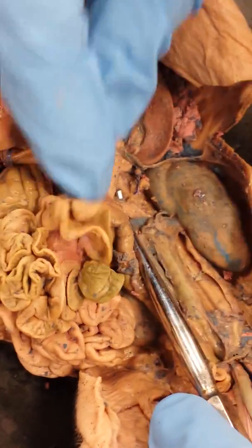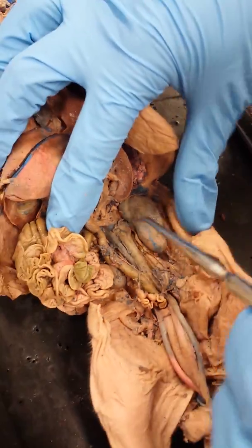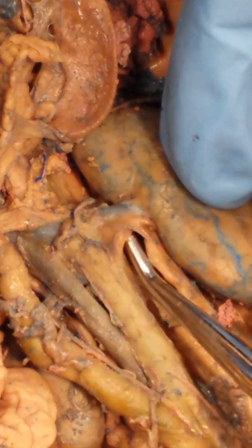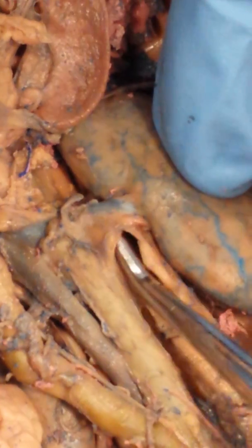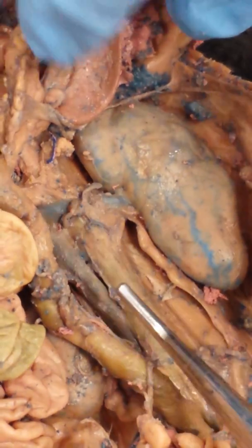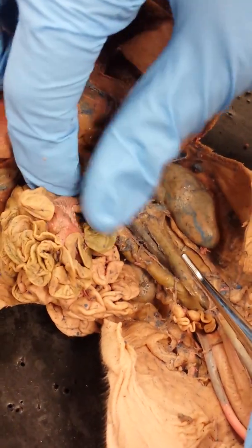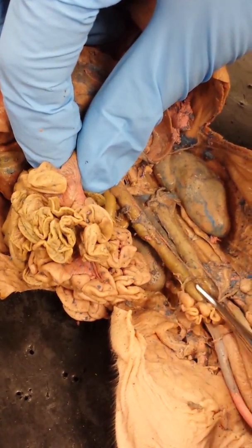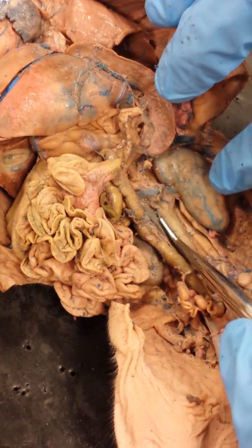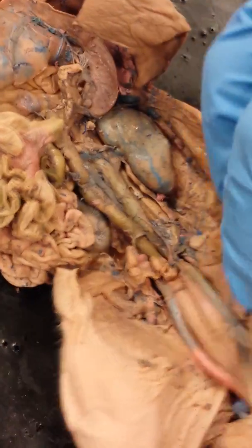Okay? Now, you should know that this is the kidney. So then the artery taking oxygenated blood to it is called the renal artery. Okay? Now, we can't see the inferior mesenteric. That's something else you want to know, that the inferior mesenteric is actually taking some blood to the large intestines and rectum.